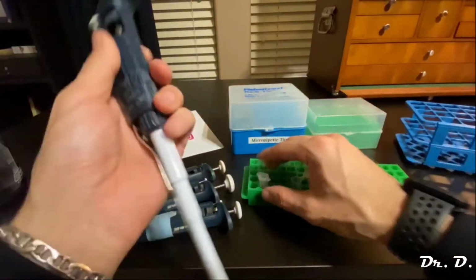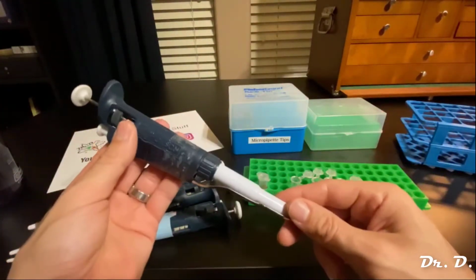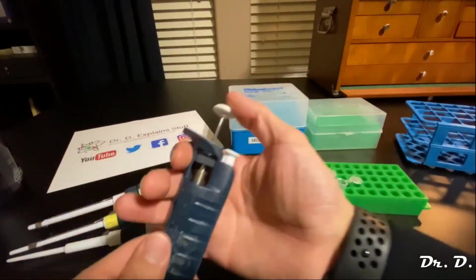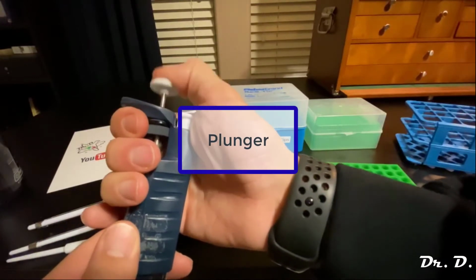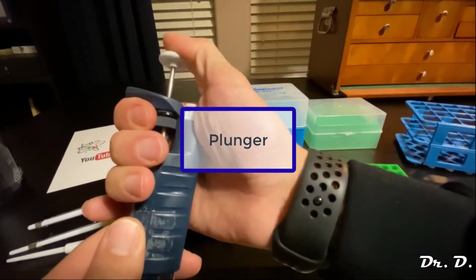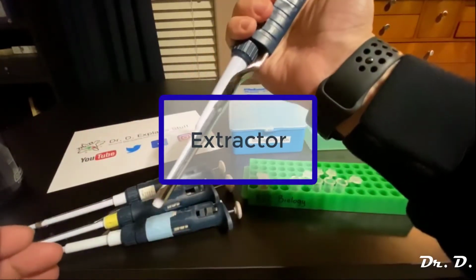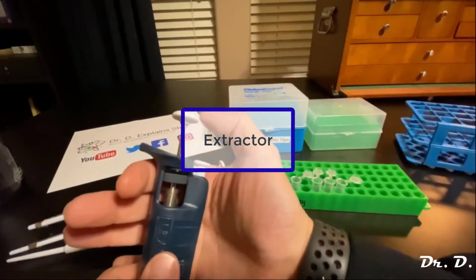So let me explain a little bit more about this. So let's see if we can get that done. Right here you have a plunger, okay? The micropipetter has a plunger, and it has this other button here that's called the extractor. It extracts the tips, okay?